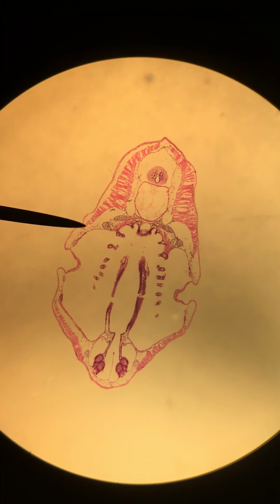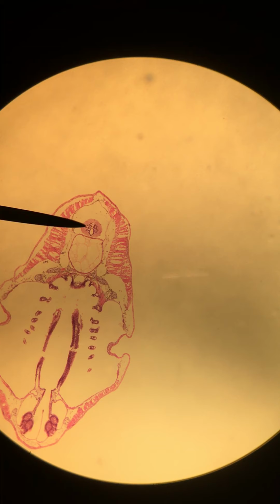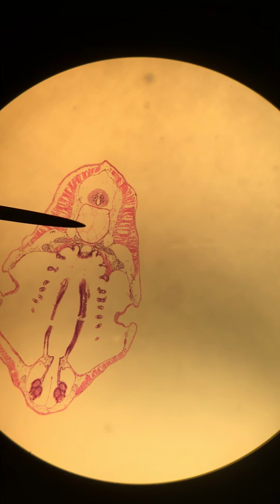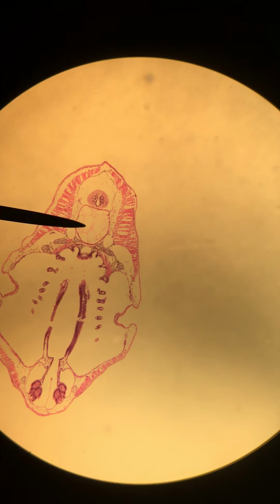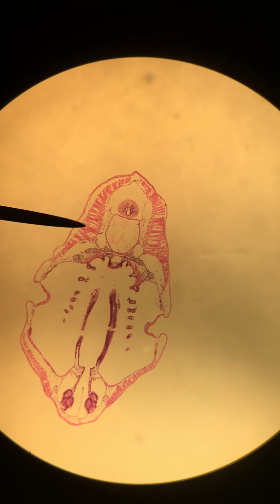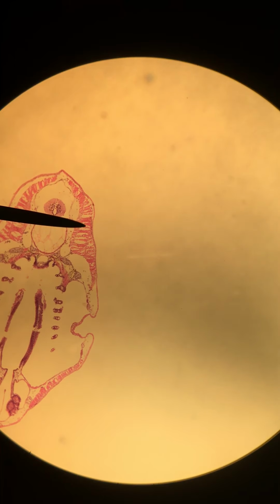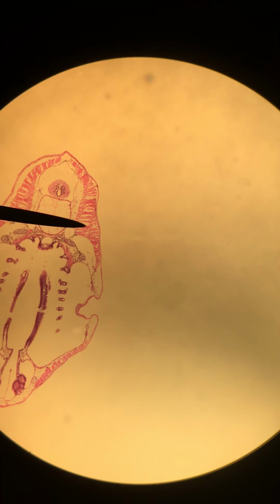This one, like I said, is the most anterior that I could find, and it looks a lot more like figure 19. We're a little bit behind the brain now, and you can see the spinal cord. I'll start here. This is the spinal cord, and just ventral to that is the notochord. On either side, both of these are surrounded by muscles, or myomeres. So here and here, all of that.